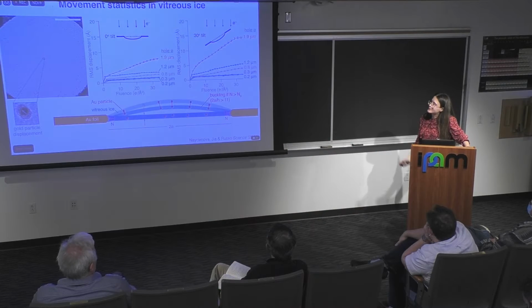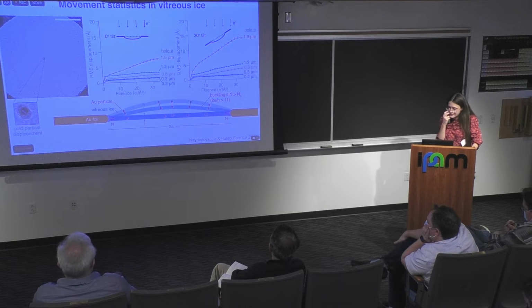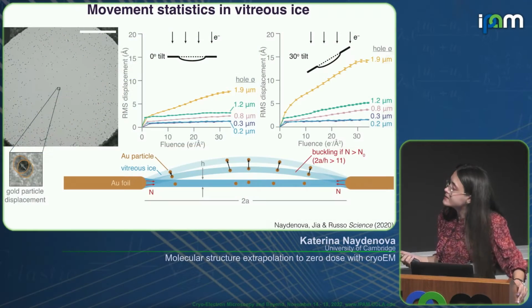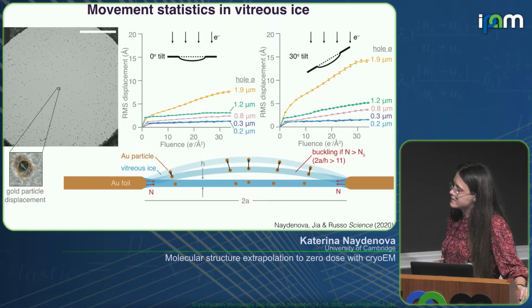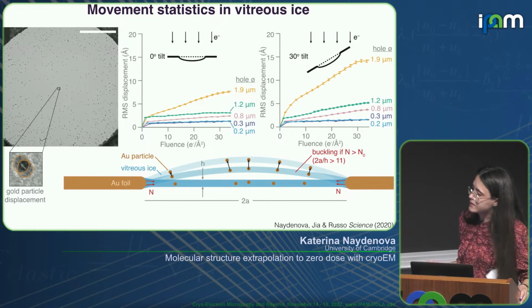And if you make the calculation, this amount of movement that we measured in these small holes is exactly the amount expected from the Brownian motion of the water molecules within the ice, kicking around these much more massive gold nanoparticles within the ice. So we thought this is very interesting. It turns out that if we make the hole in the supporting foil small enough, we can remove all the non-Brownian component of the movement, which is the correlated movement of the ice as a whole, which, from these measurements and from the trajectories of the particles, seems to be some type of buckling deformation.